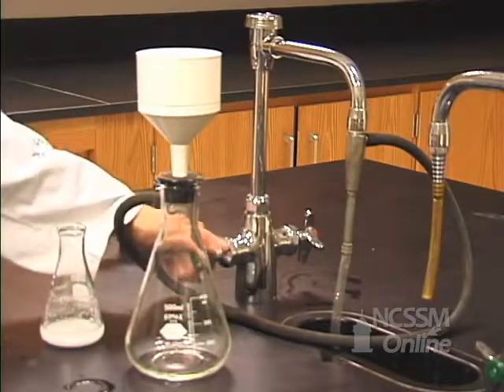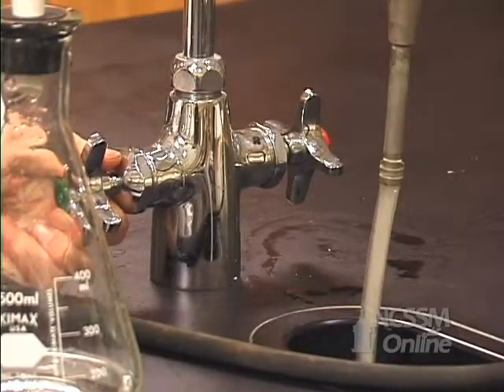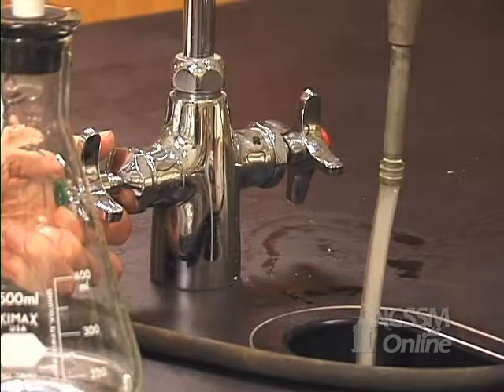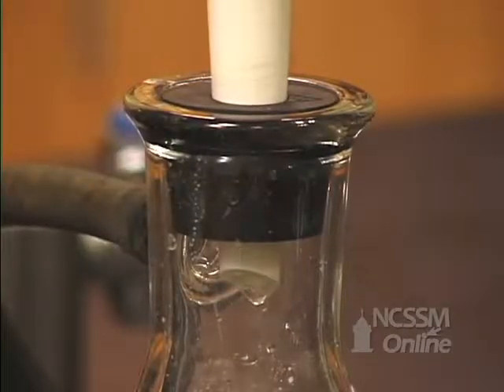And when we turn the water on, you see water is running down. That running water creates this low pressure here.